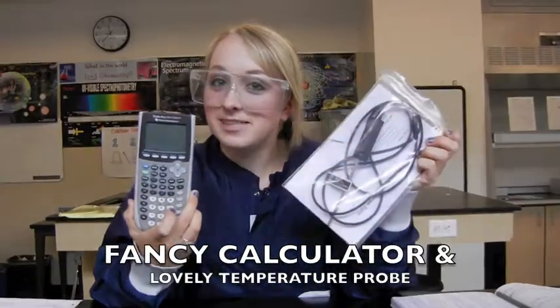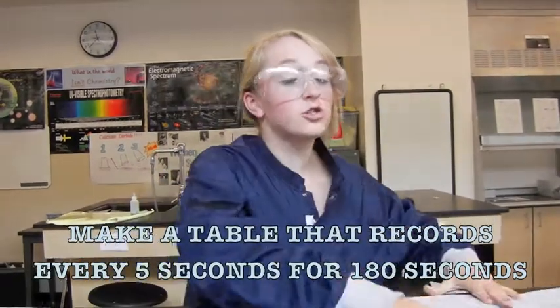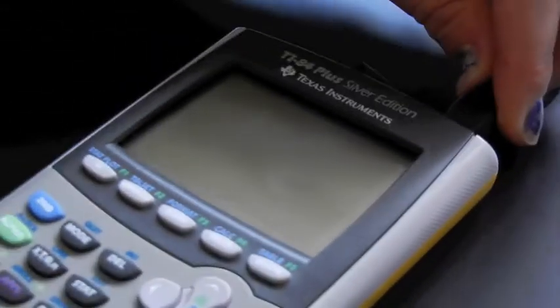Since we are so fortunate to have these fancy calculators and lovely temperature probes, you get to record every 5 seconds instead of every 20 seconds like the lab says. So be sure to make a good table in your lab notebook. First, you need to turn the calculator on, then plug in the temperature probe. Then this fancy program will come up. Since we're recording every 5 seconds, we need a time graph.